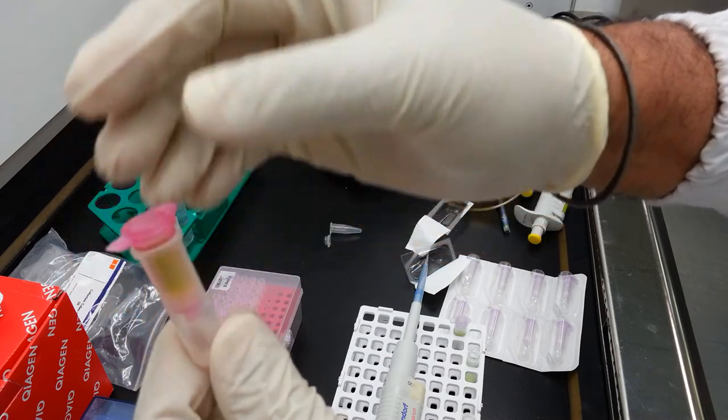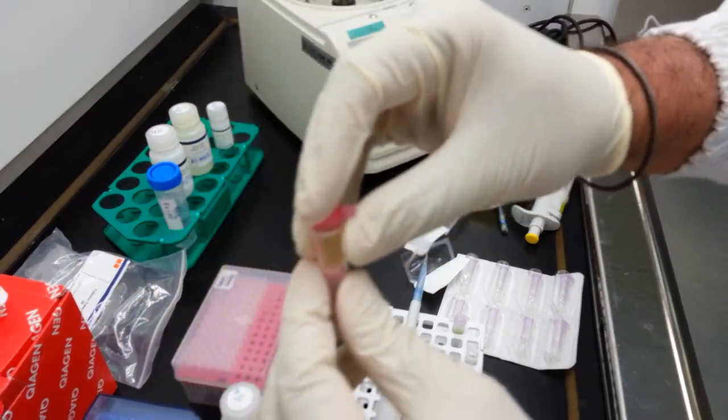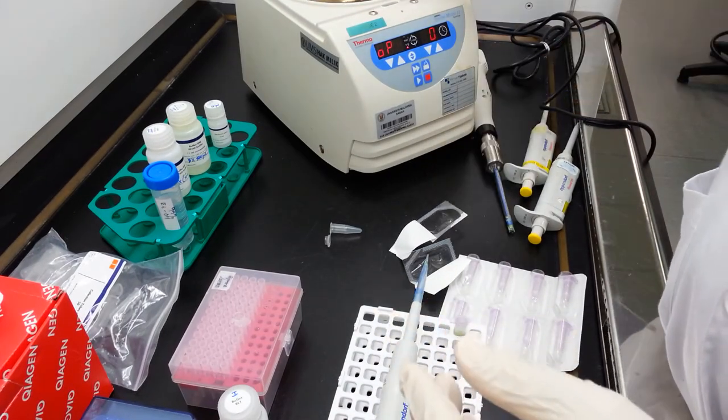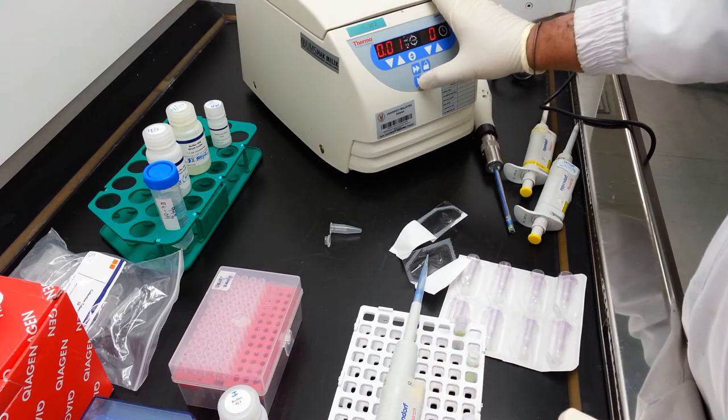Now from this step onwards, centrifugation is done very briefly. So I am centrifugating this tube at 13,000 G for 15 seconds.